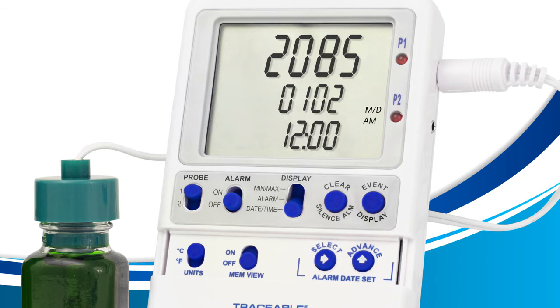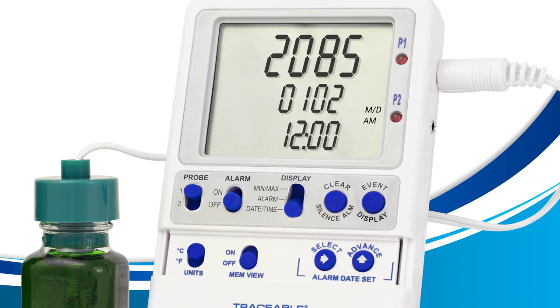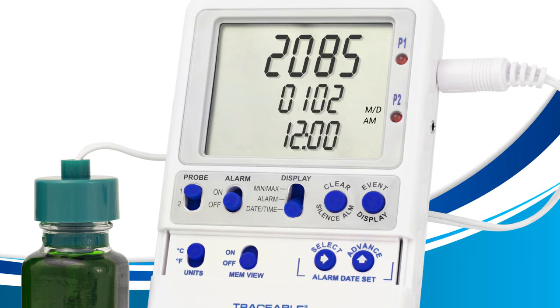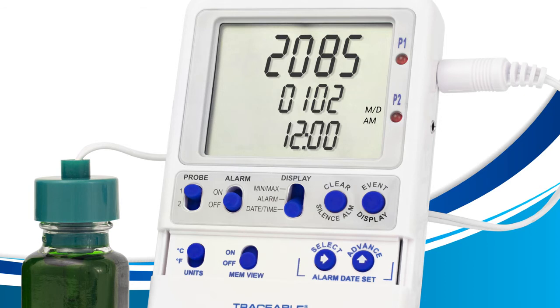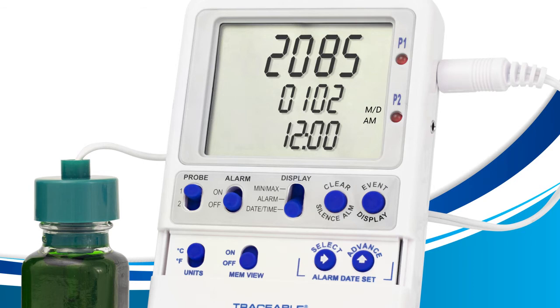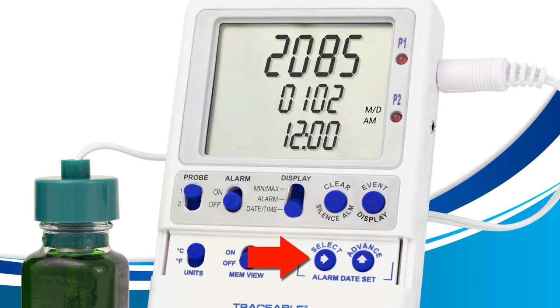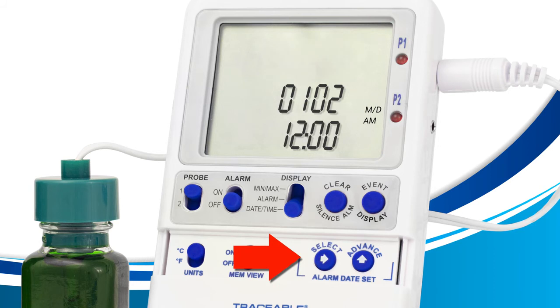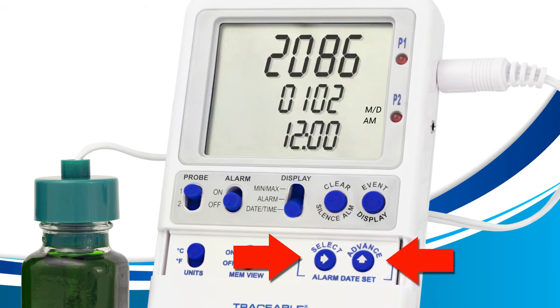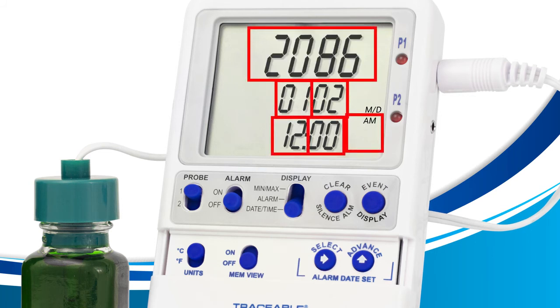The select button allows you to select fields on your screen. Now let's learn what the advance button does. The advance button allows you to modify the year, date, and time, but it will only change the value of a field that has been selected by the select button. The area that's flashing is what's currently selected. Since no fields are currently flashing, pressing the advance button does nothing. But if we press the select button first to select the year, pressing the advance button will change that value.